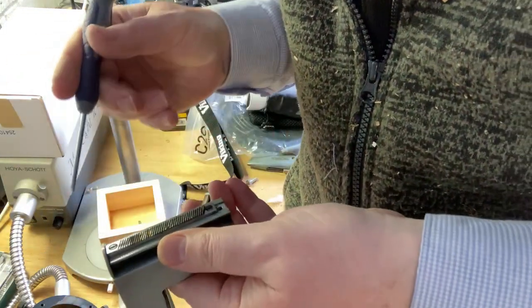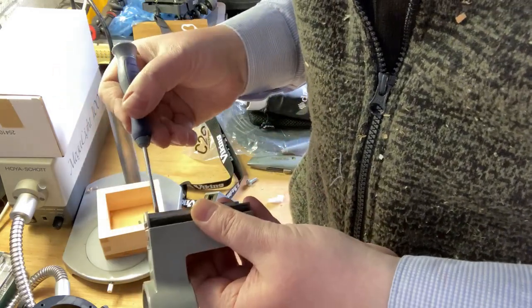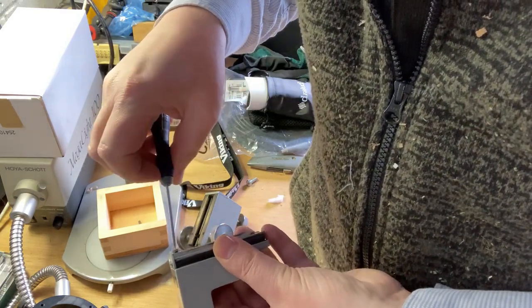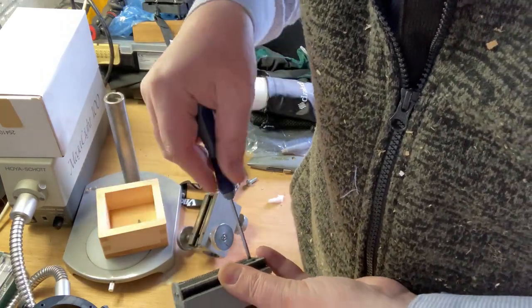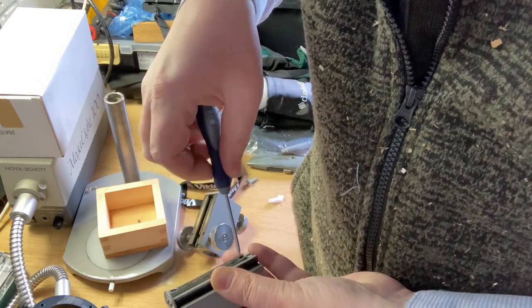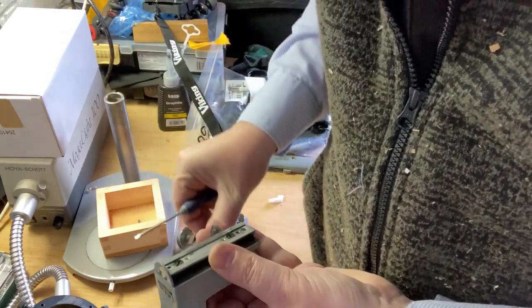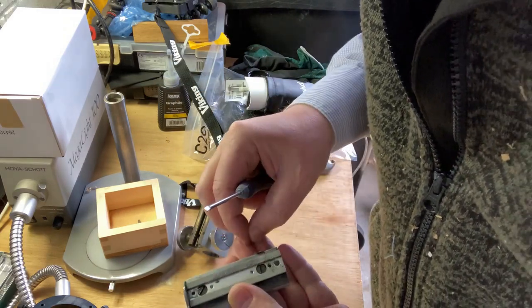So one bit is to actually replace this section, and if I just unscrew this, okay, there's a little bit of foil from at the bottom.